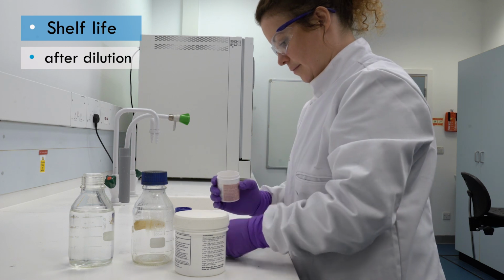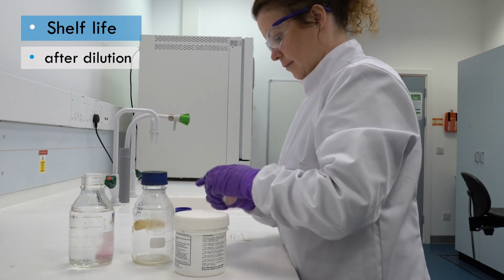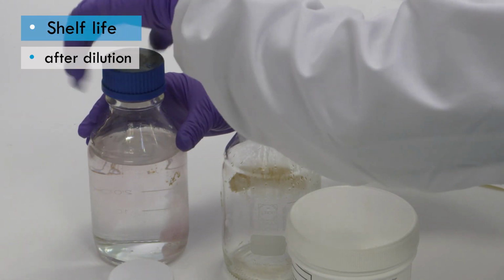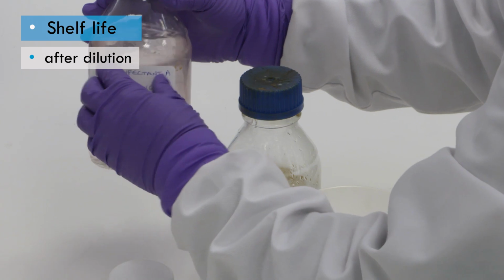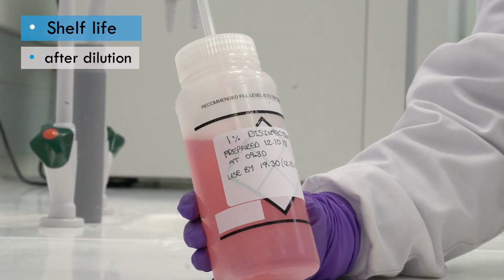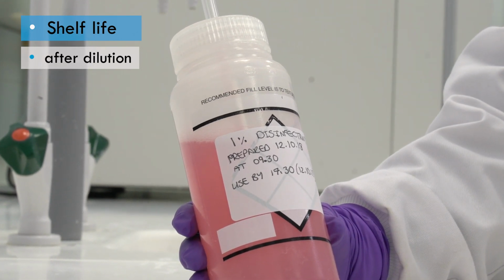For disinfectant products that require dilution, the manufacturer's instructions will state for how long the disinfectant will be effective once diluted. This should be used to calculate the use-by date for the diluted product, and this date should be recorded on the container. If more disinfectant is needed after this time, a fresh solution should be prepared.